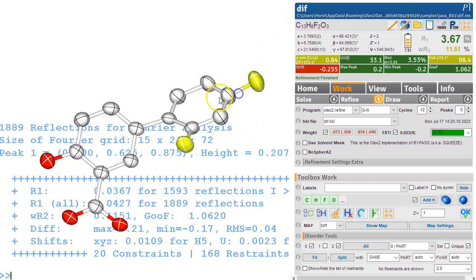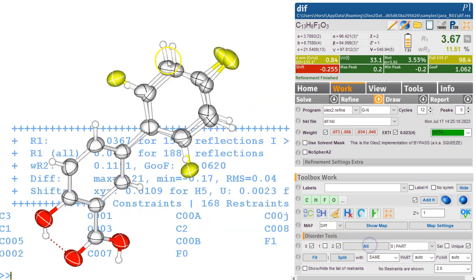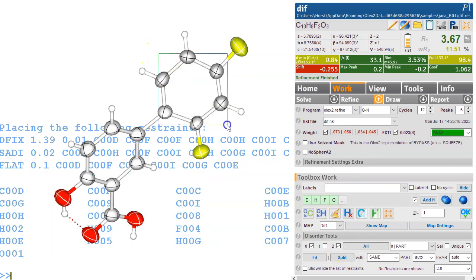Now this does not look like a very healthy six-membered ring. Again, it's not unsurprising because we are refining all of these objects very much close in space. So one thing we can do is restrain them by selecting all 6 carbons, and RRINGS is the command, RRINGS, and then what have you got? 1, 2, 3, 4, 5, 6 carbons. There could be a nitrogen in there or something else, so this is how you can put that in. So this puts the DFIX, SADIs and FLATs in there to keep that ring sane, and we do exactly the same to the other one as well.